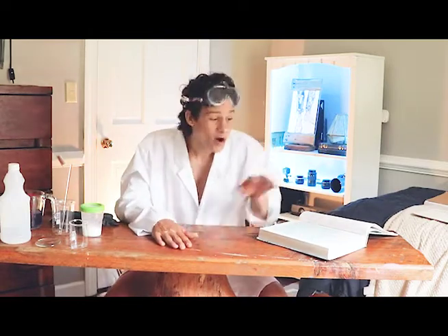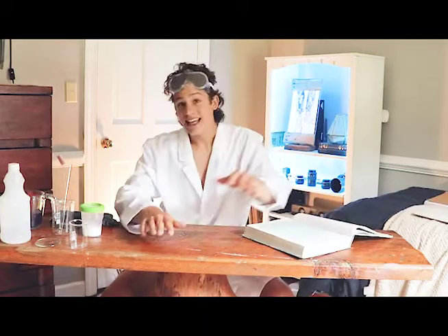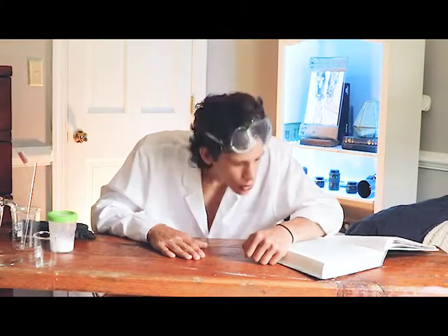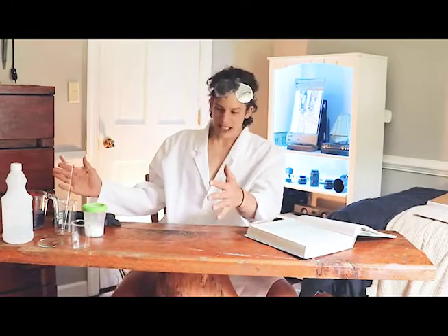But this one, boy, is this a banger! This is a good experiment. We're looking at Experiment 2.1 in the Apologia Chemistry textbook. Today this experiment demonstrates the first law of mass conservation, which states that matter cannot be created or destroyed — it can only change forms.